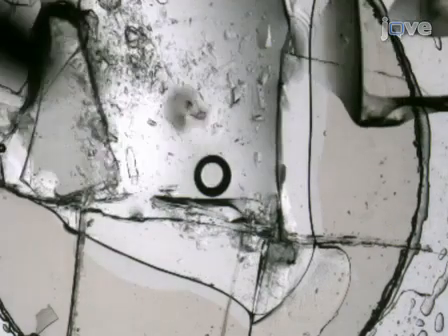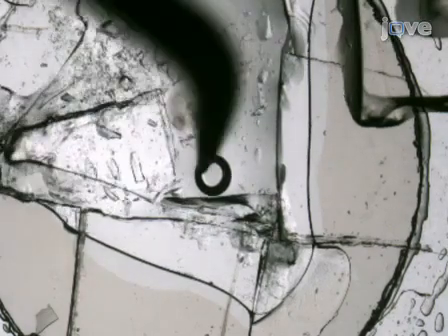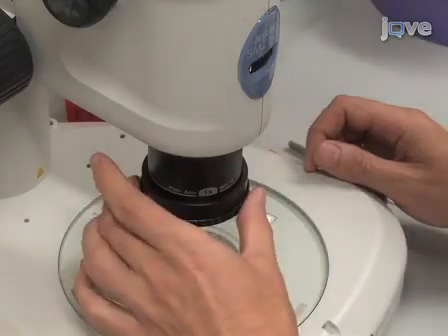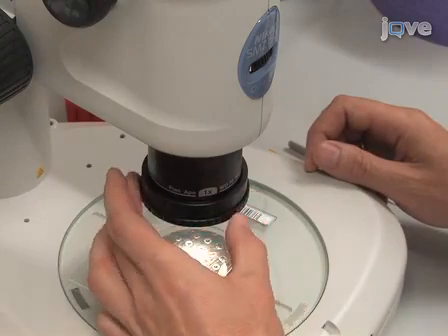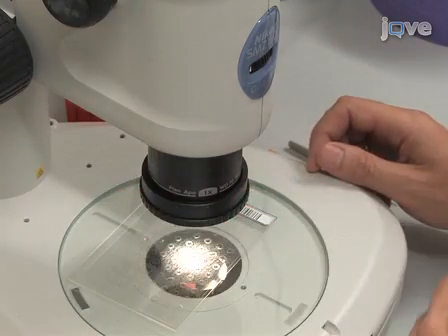Add an extra few microliters of precipitant solution, supplemented with a cryoprotectant if necessary, on top of the exposed cubic phase bolus in the well. Increase magnification of the microscope and focus on a crystal. Adjust the angle between the polarizer and the analyzer to increase the contrast between the birefringent crystal and the background, while keeping enough light to see the harvesting loop.